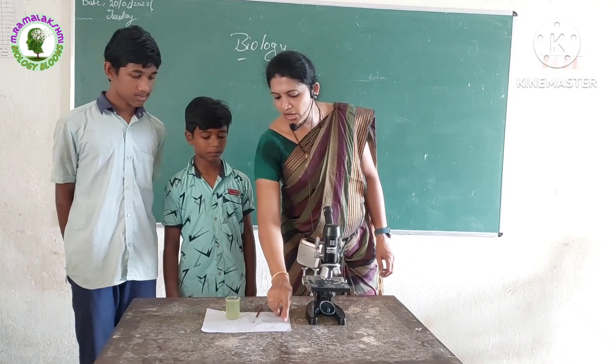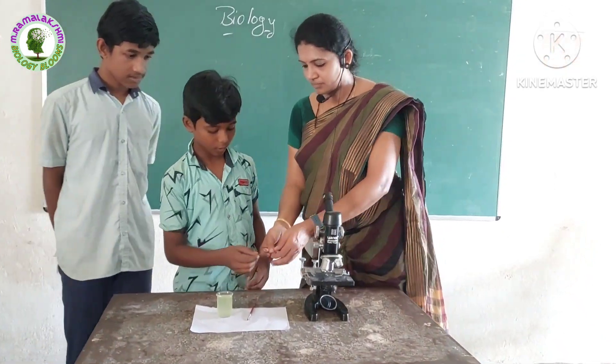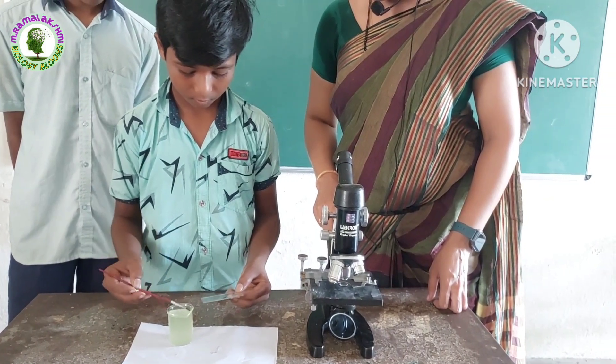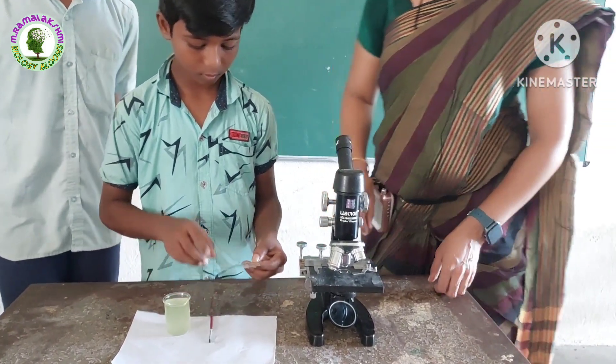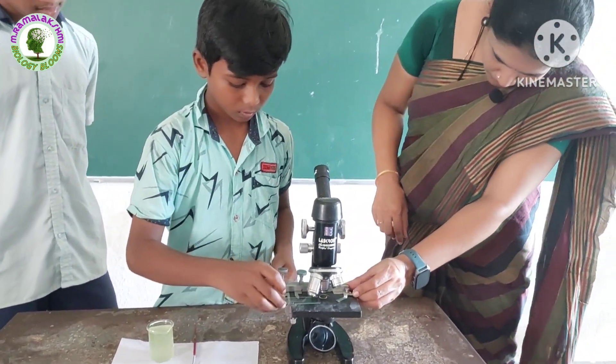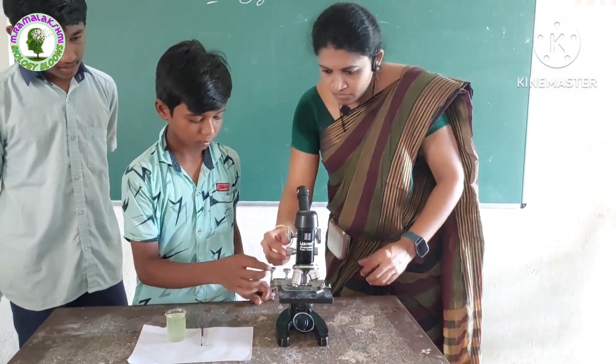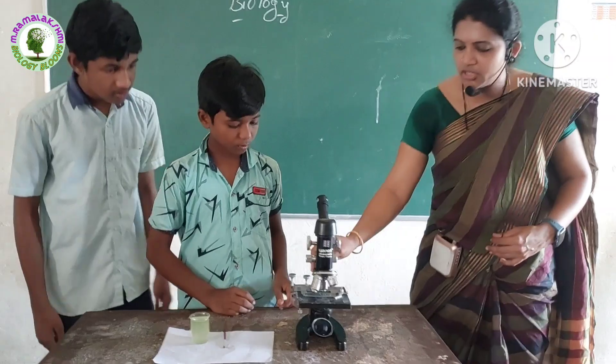Satish, pour some water on the slide. Now place it under the microscope. Okay, now observe it.